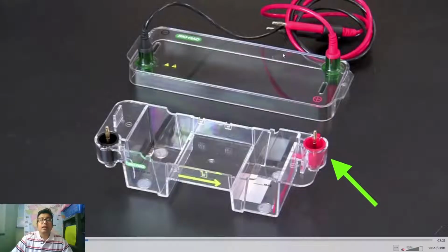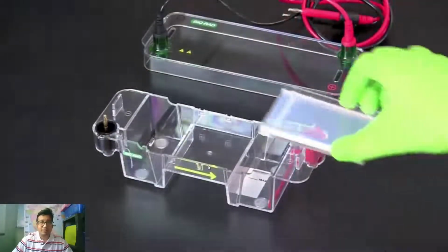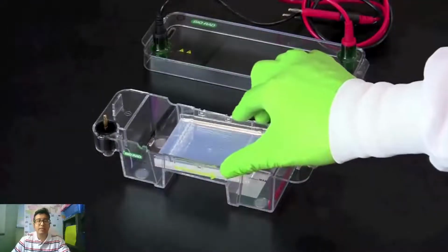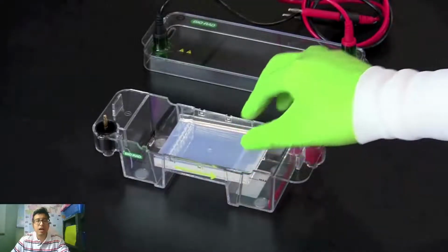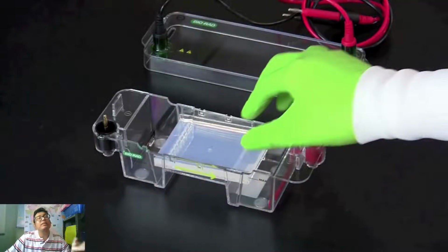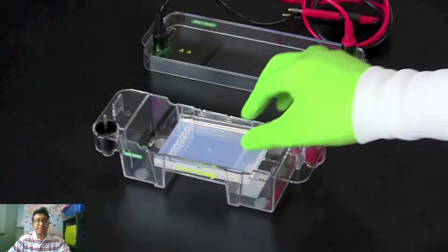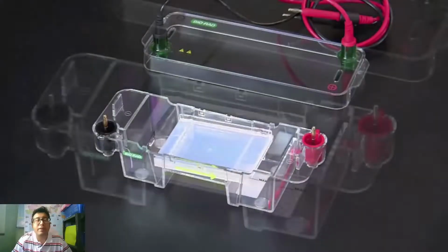Fine. We need to place the agarose gel on top of the tank. Okay, see the agarose gel is placed on the tank. Now, there can be two ways: either you fill the whole thing with the buffer, or you place the buffer just below the tank and you place a filter paper and connect one end to the gel and another end to the buffer. In case of DNA, it is generally fully filled with the buffer.